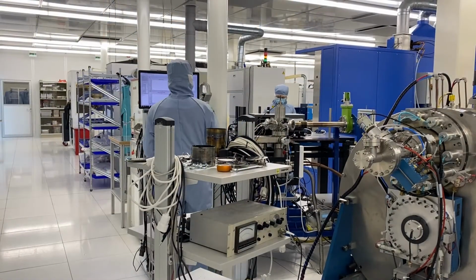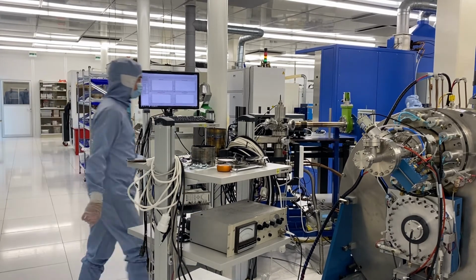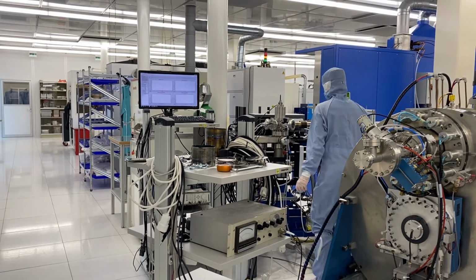I am currently running experiments here on electron-irradiated beta gallium oxide, which is, among other things, a promising material for use in power electronics. And to that end, control over defect population is vital, because even the smallest amount of defects can determine if a device works or not. So we are looking at intrinsic defects, which were created by low and high energy electron beams. And currently not much is known about the energetic position of intrinsic defects in gallium oxide. And in contrast to impurity-related defects, the formation of these intrinsic defects cannot be suppressed completely. So learning what their properties are and how they impact the material is important for designing good devices.